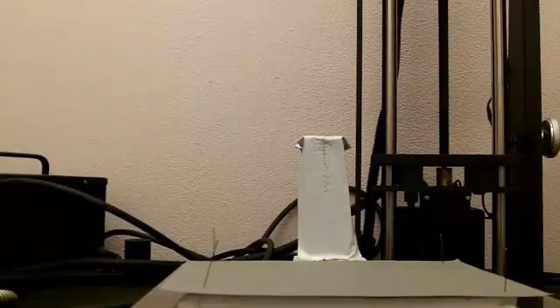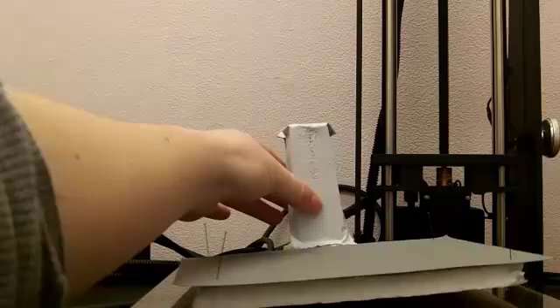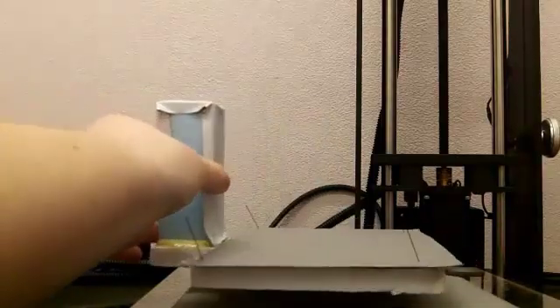I will now go over the proper way to prepare a dry-mounted specimen for both a lateral and a head shot. This stand is the type of stand used for both shots.